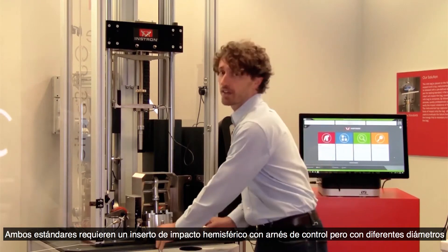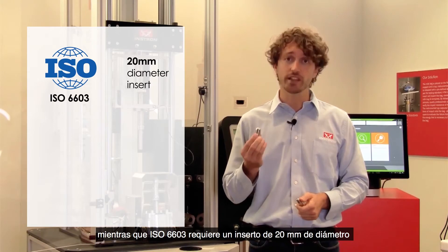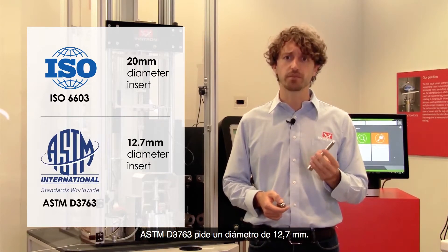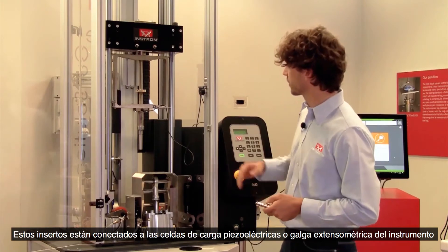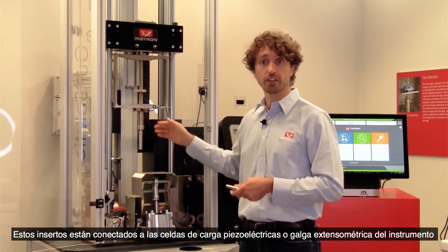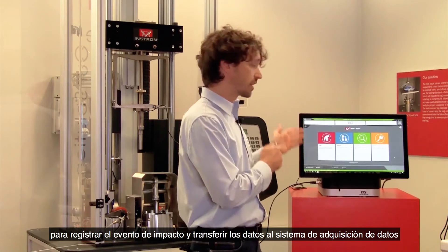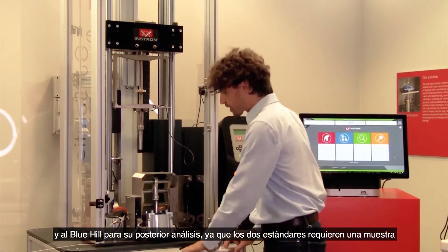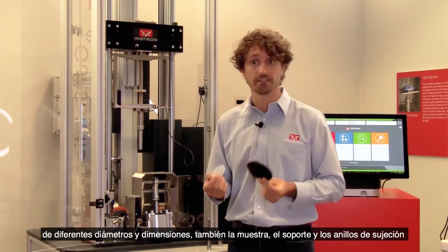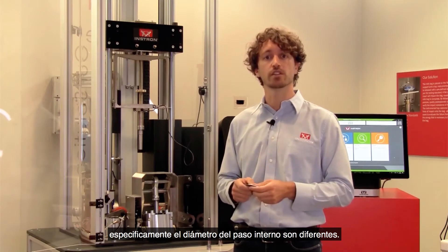Both standards require a hemispherical impact insert with controlled hardness but with different diameters. While ISO 6603 requires a 20 millimeter diameter insert, ASTM D3763 asks for a diameter of 12.7 millimeters. These inserts are both connected to the instrument's piezoelectric or strain gauge load cells to record the impact event and to transfer the data to the data acquisition system and Bluehill Impact software for further analysis. As the two standards require specimens of different diameters and dimensions, also the specimen support and the clamping rings — specifically the diameter of the internal passage — are different.